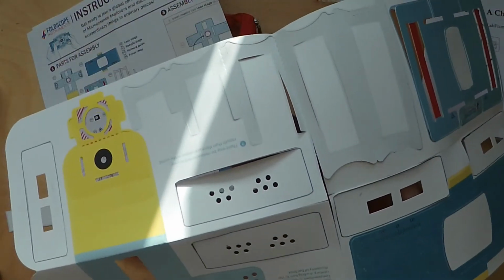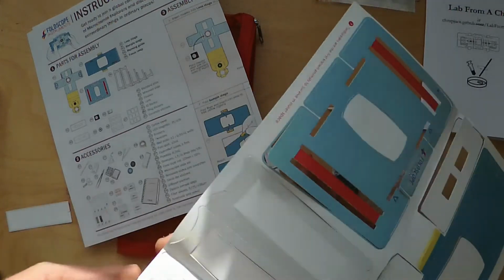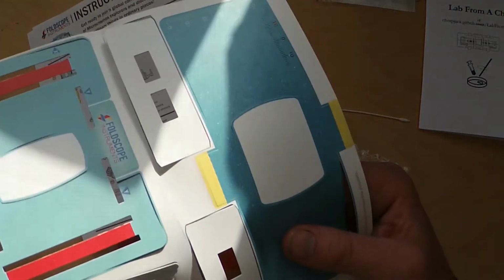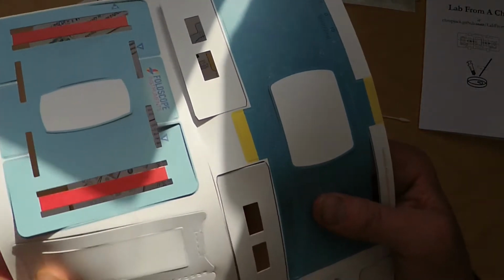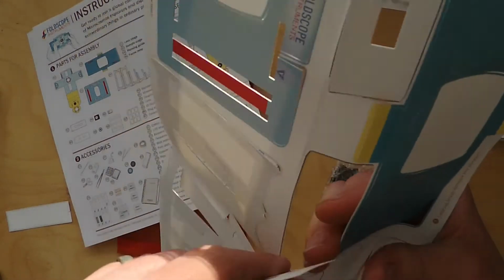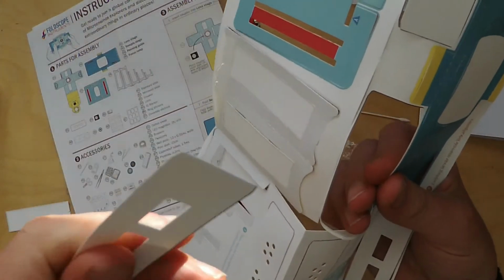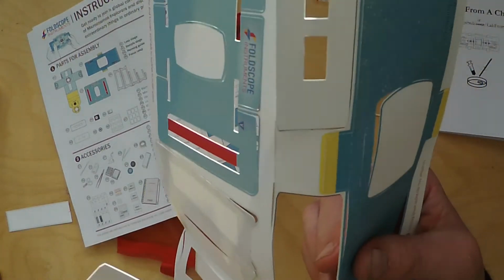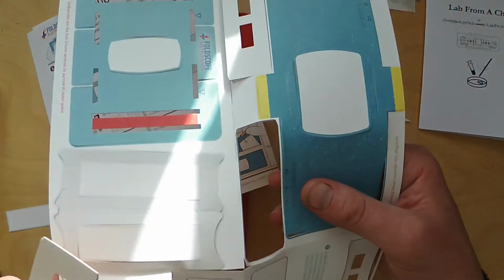This kind of cardboard is very specifically designed. It's really resilient, so you can be quite vigorous in the way that you pop out the different components. Don't worry too much, the card can take it. It's really stretchy and it maintains its shape, so don't be too afraid when you're popping all these elements out.